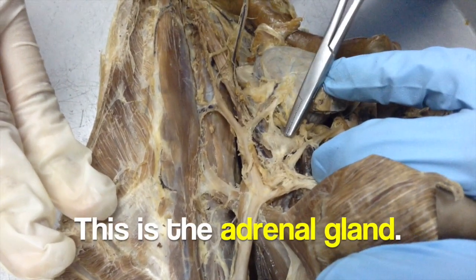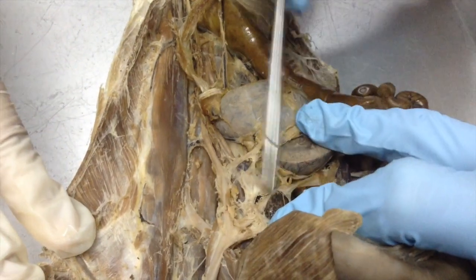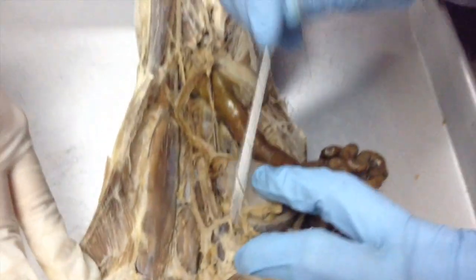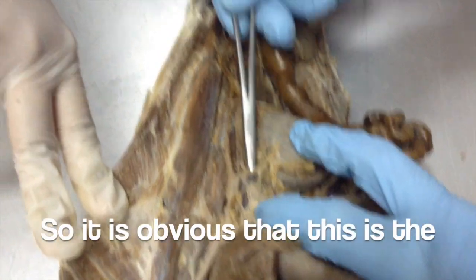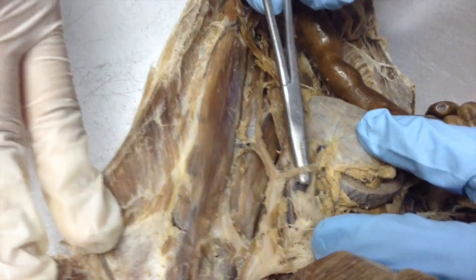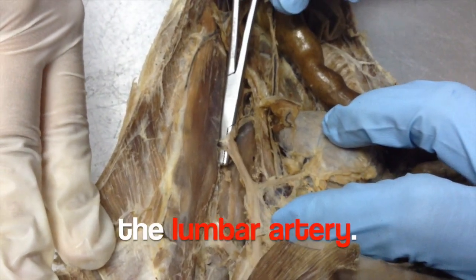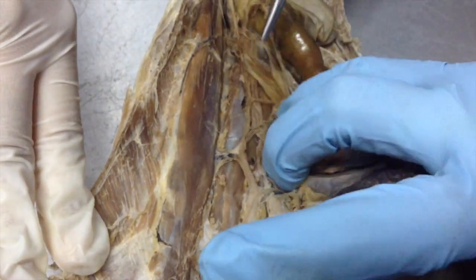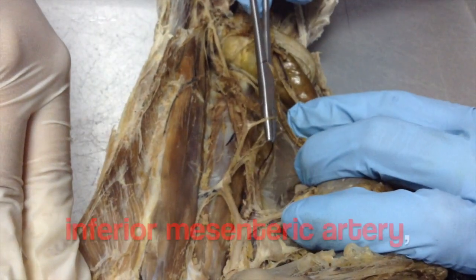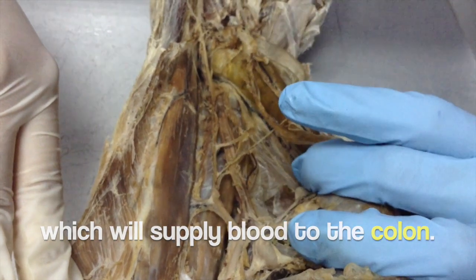This is the adrenal gland, and this is the kidney. It is obvious that this is the left adrenal artery. You can see here the lumbar artery, and here is the inferior mesenteric artery, which supplies blood to the colon.